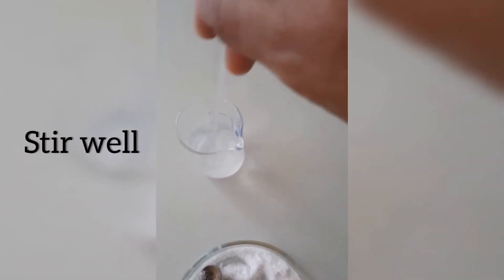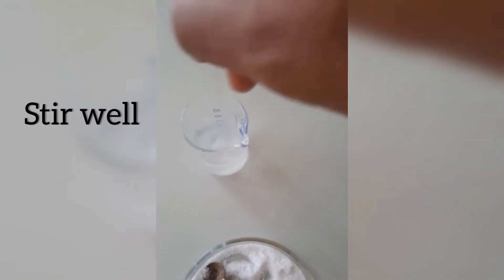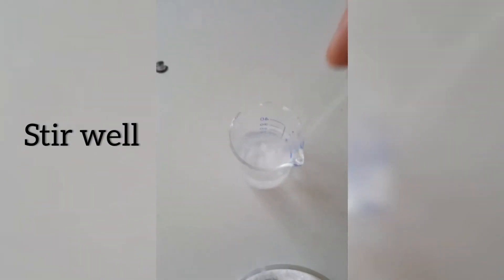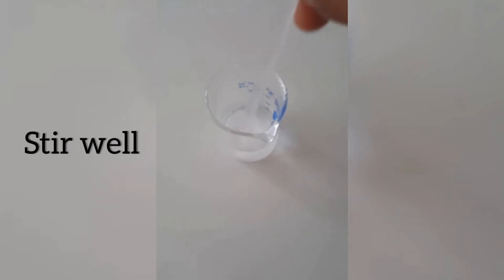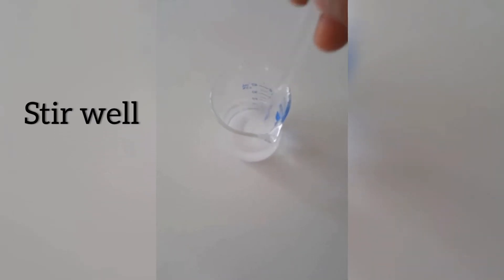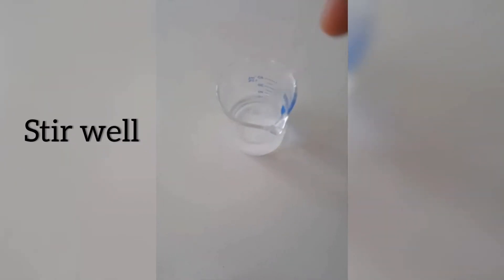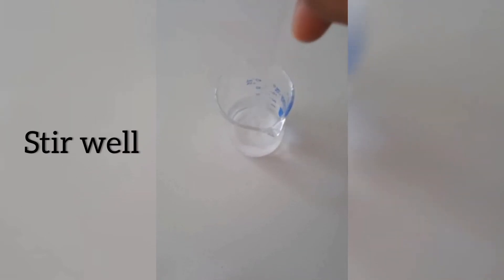Stir the mixture well so that sodium sulfate will dissolve into water. This is the second solution we are making, that is barium chloride solution. Stir it well so you will get the barium chloride aqueous solution. Aqueous solutions are made by mixing the substance in water.